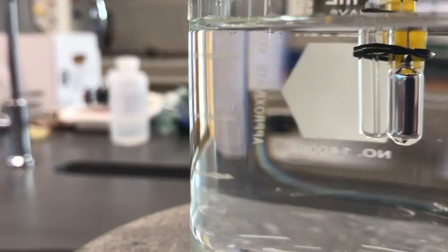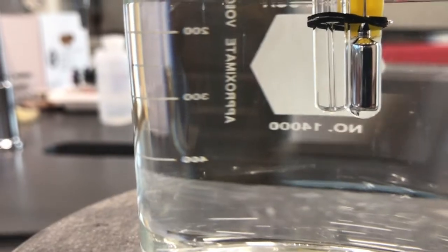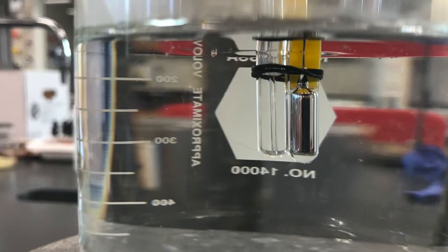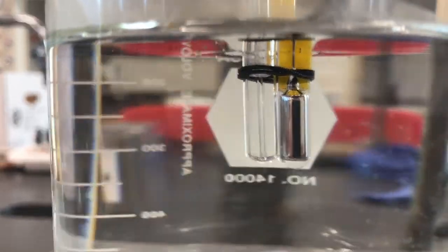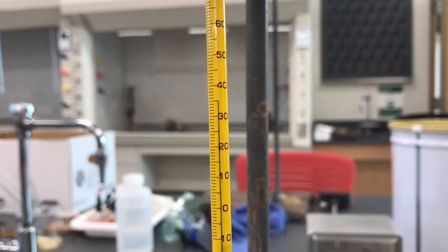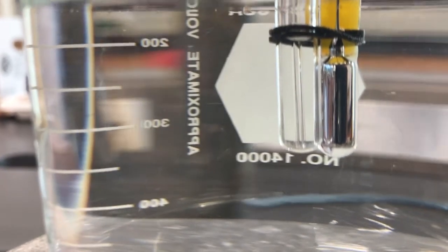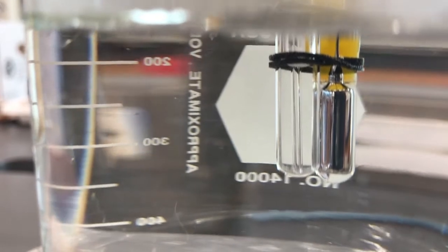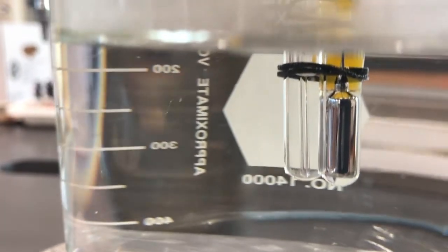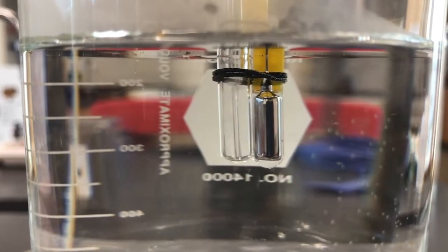We're heating the little test tube assembly, and you might be able to start to see just little bubbles coming out of that thing as the vapor inside is starting to expand and get pushed out. So you can start to see a little bit more bubbles. Pentane is a really low boiling compound, so it's not boiling yet, but it's only 35 degrees. You can already see that we're getting pretty close. So we'll heat past the boiling point and then we'll watch it slowly cool. Take this out and see what happens when it cools.